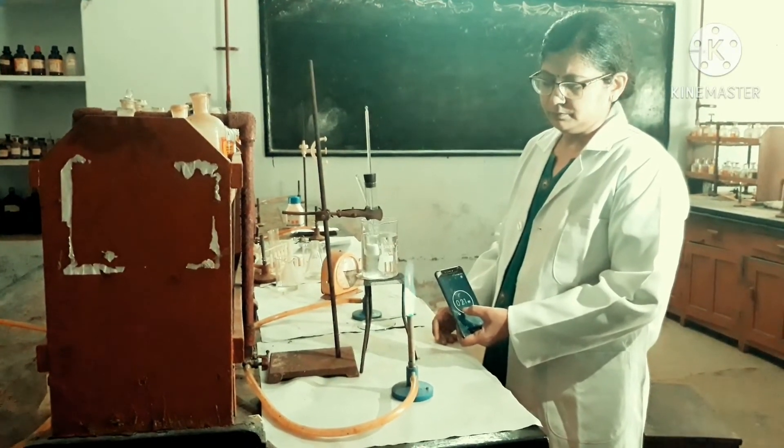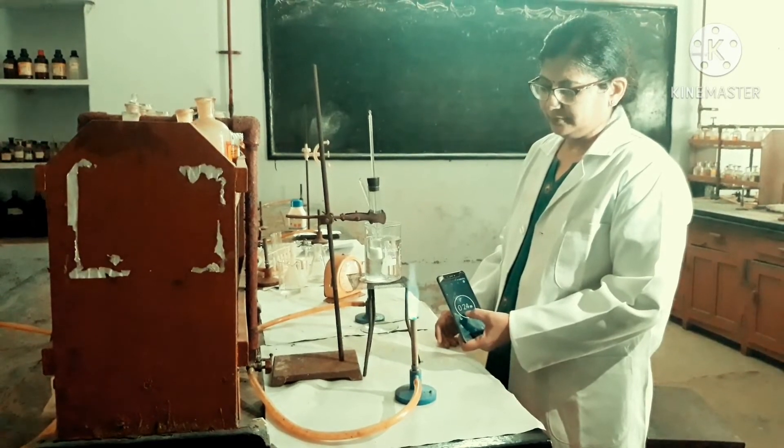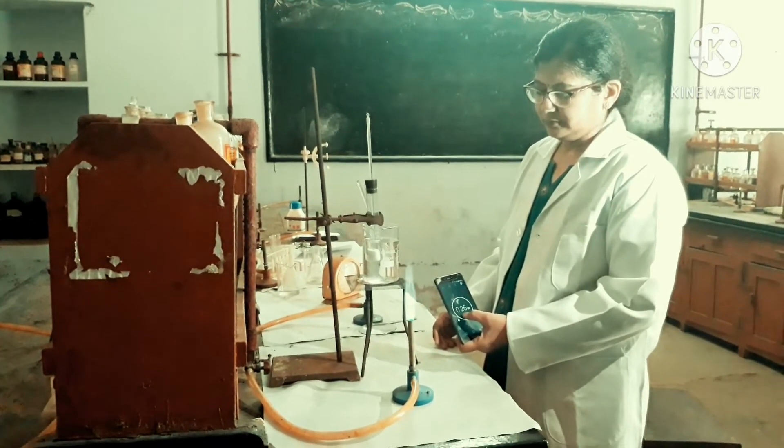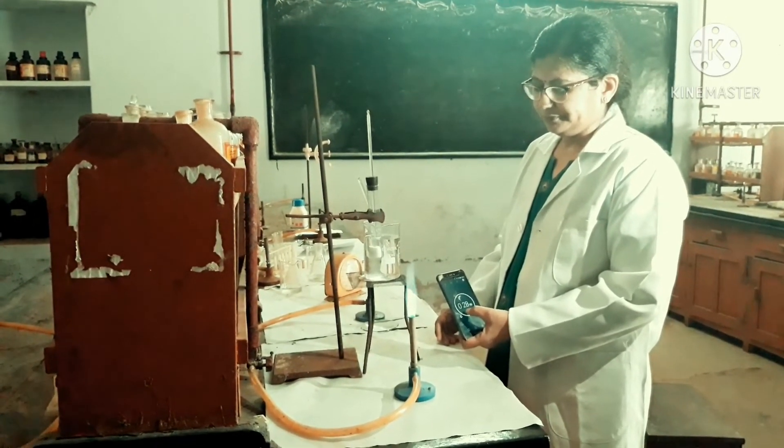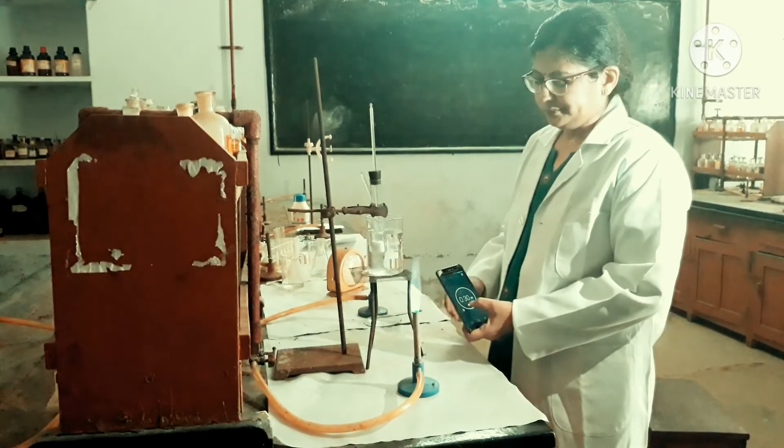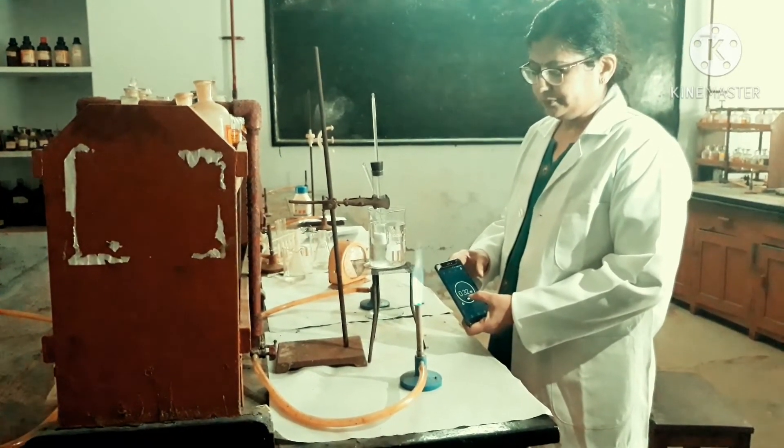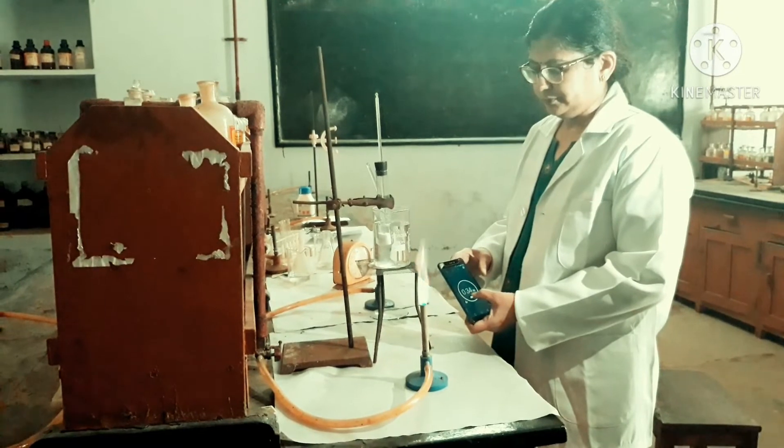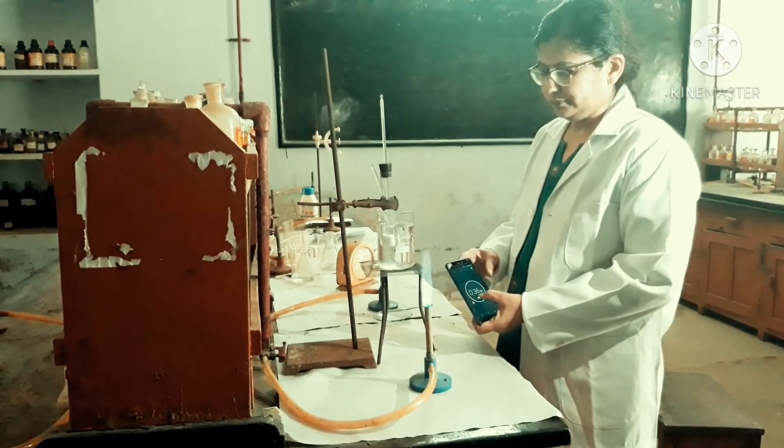At a certain point the temperature becomes constant after few minutes of cooling. Note that reading. This is T2, temperature of cooling.